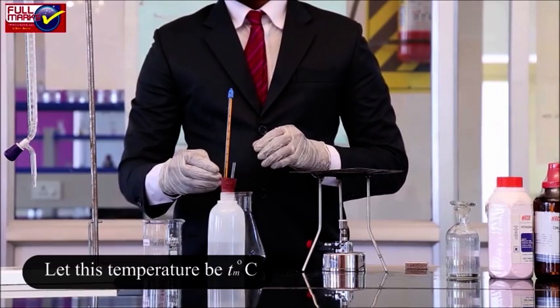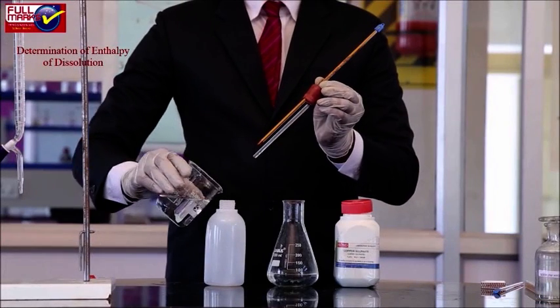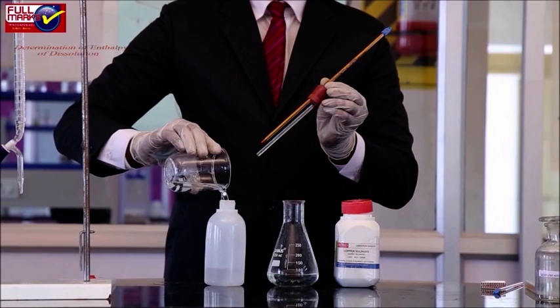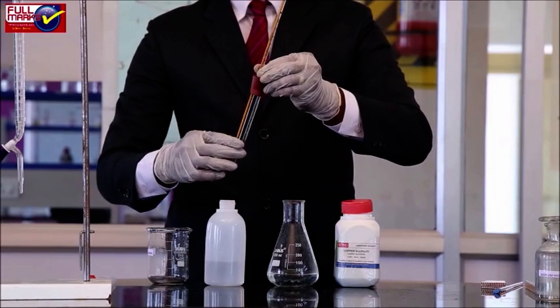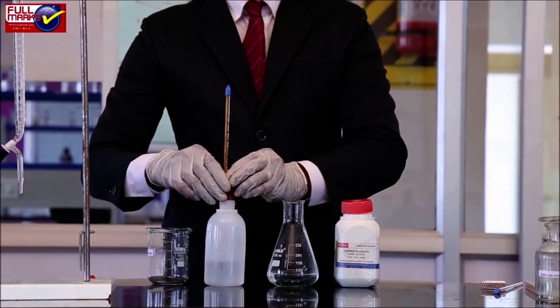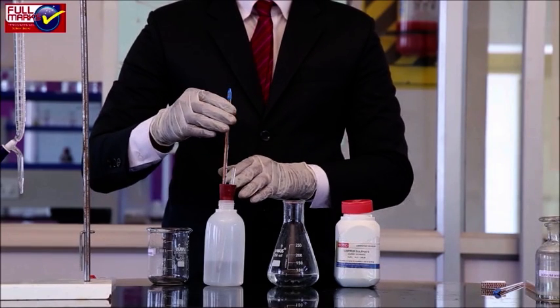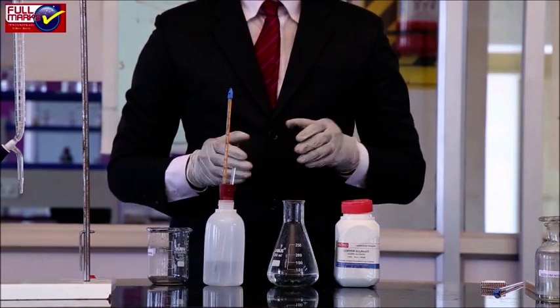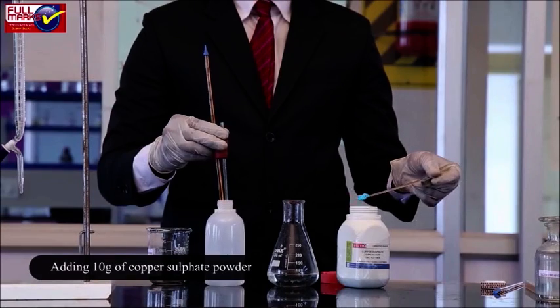Calculate the calorimeter constant for the polythene bottle using equation 3. For determination of enthalpy of dissolution, take 100 ml of distilled water in the polythene bottle and fit a cork with two holes in it. Insert the thermometer and stirrer in these two holes. Note the temperature and let it be T1 degrees Celsius. 10 grams of copper sulphate powder is put in the bottle and the cork is immediately put back.